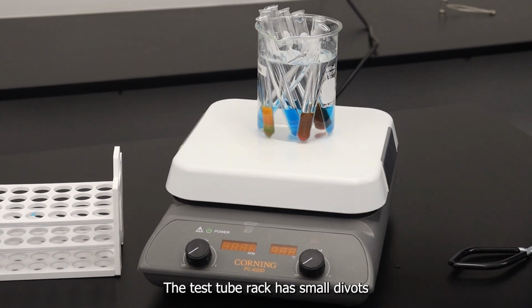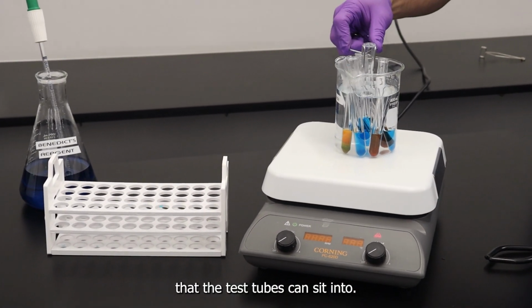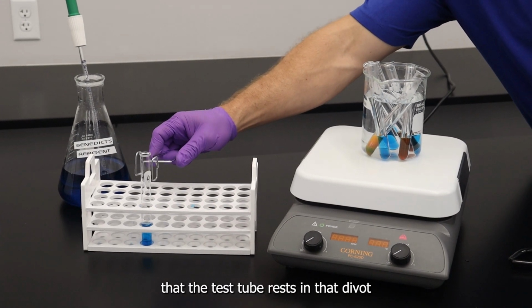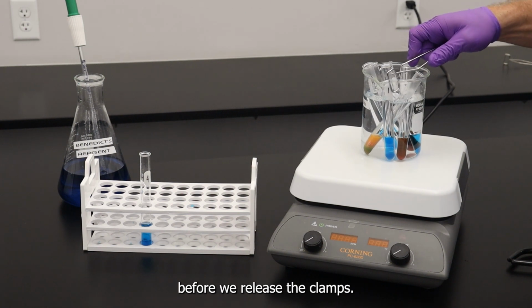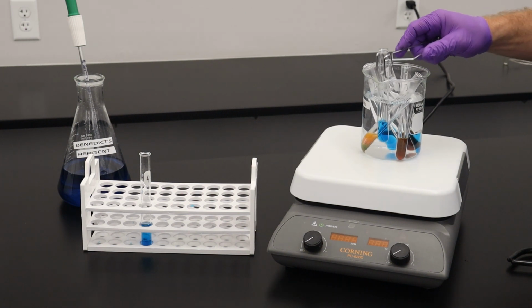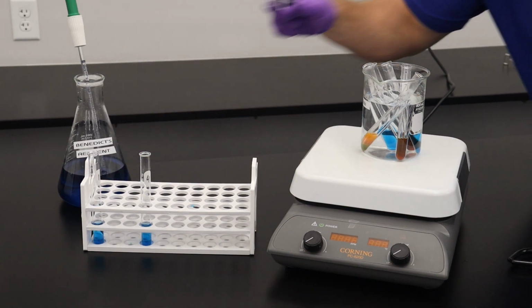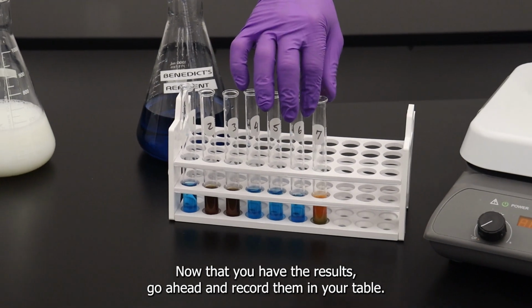The test tube rack has small divots that the test tubes can sit into. So it's important that we make sure that the test tube rests in that divot before we release the clamps. Now that you have the results, go ahead and record them in your table.